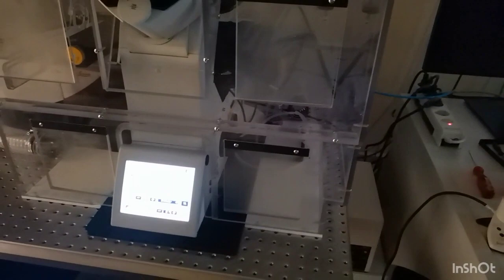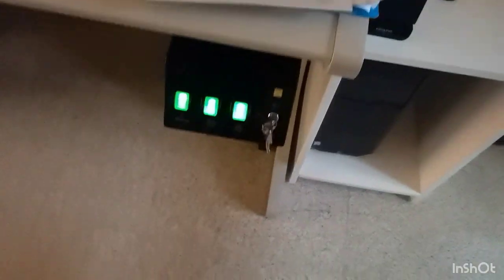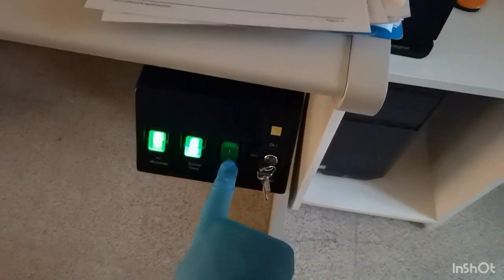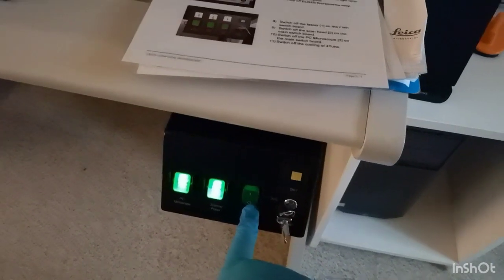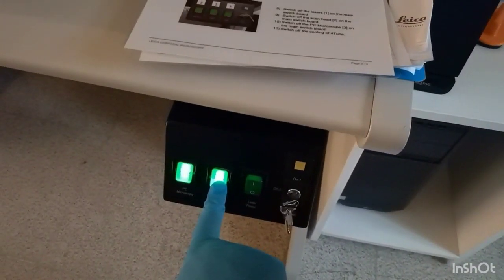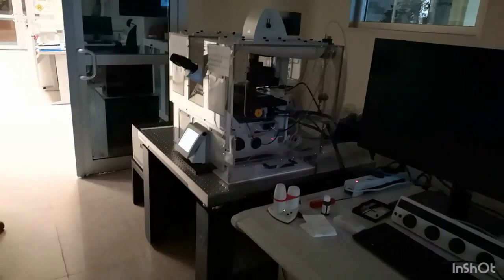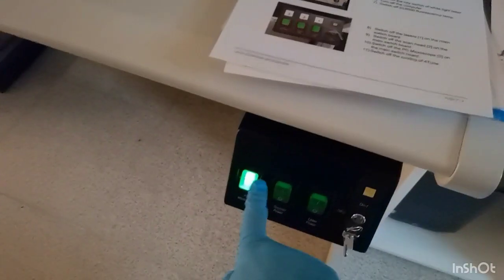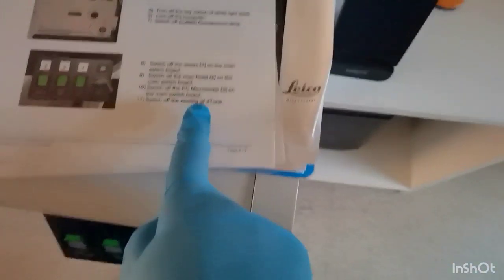Again, do not touch the bottom box. Now as you see, the microscope is still active because it goes off only after the electricity buttons are switched off. Now we close them again, waiting a few seconds in between. The last thing is to switch off the cooling unit.